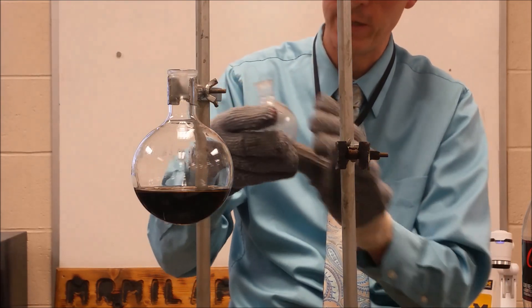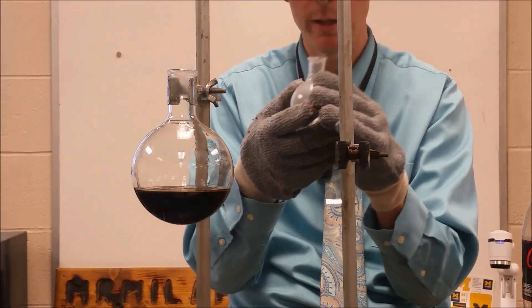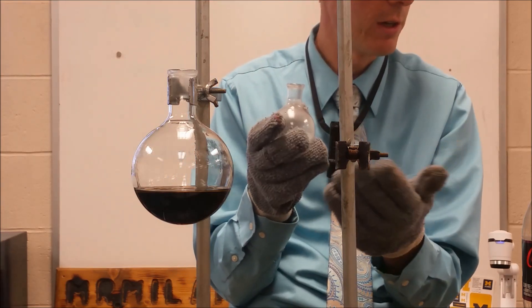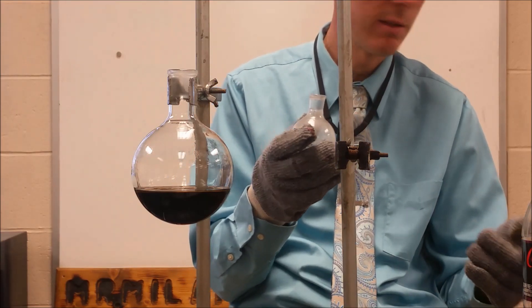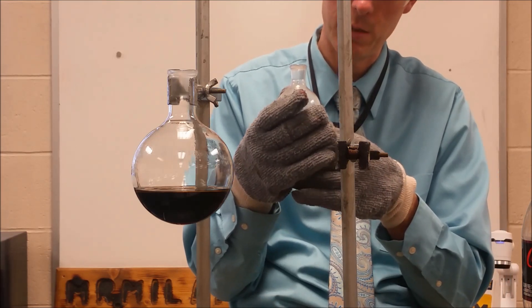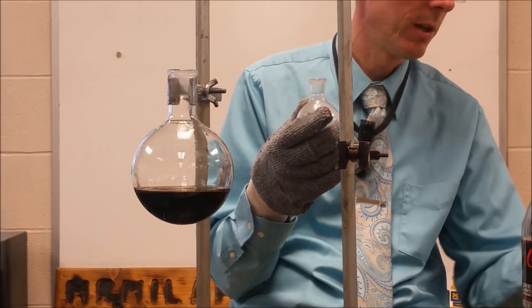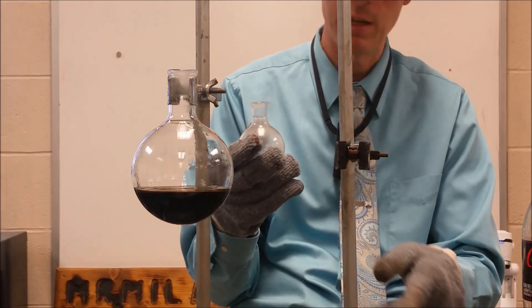It smells very similar to the one that's in the Coke Zero. So I'll pour it into a beaker to get a full comparison, but it looks like something similar to what we have in here. I would expect there to potentially be less of that in case this is something that packs some syrup with some calories, but otherwise it seems to appear to have the exact same scent.